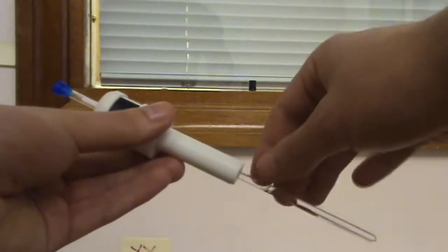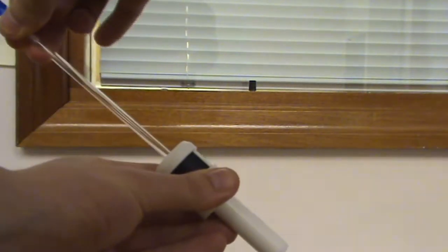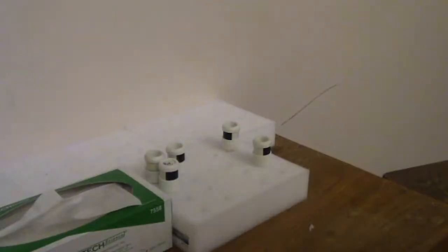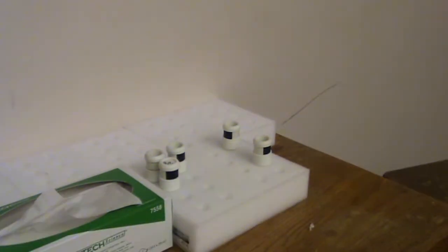After removing your spinner from the sample holder, pull the sample out of the spinner and make sure that the middle is fully extended. Do not leave the spinner lying down, as this can cause it to get warped over time. Instead, return it to the styrofoam container once you found it.